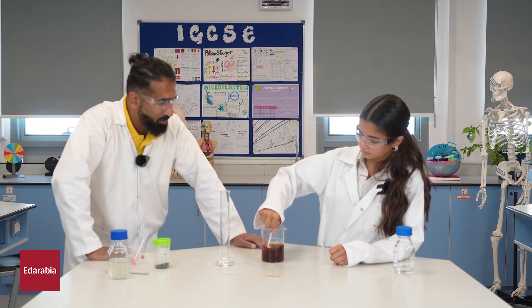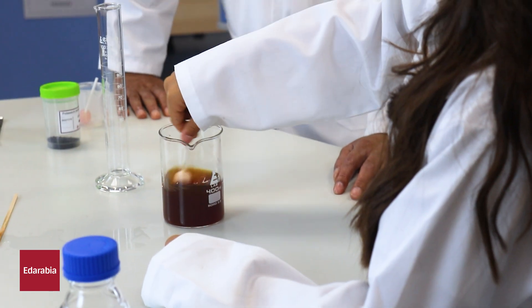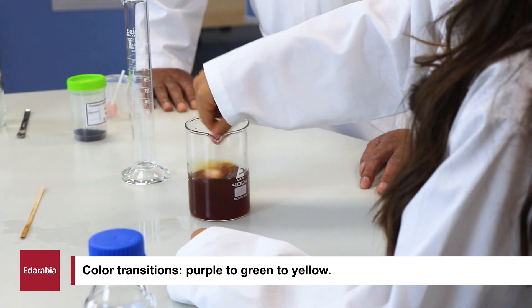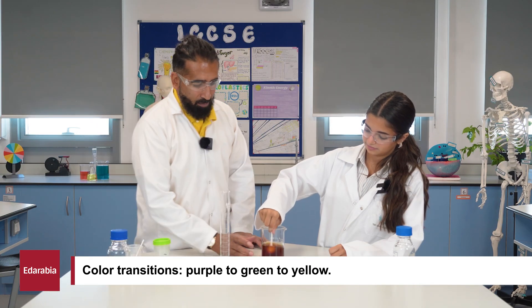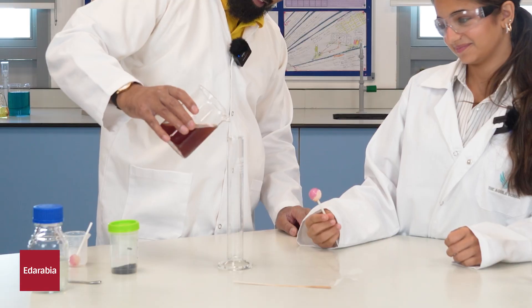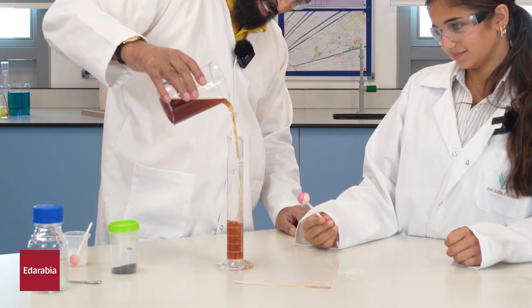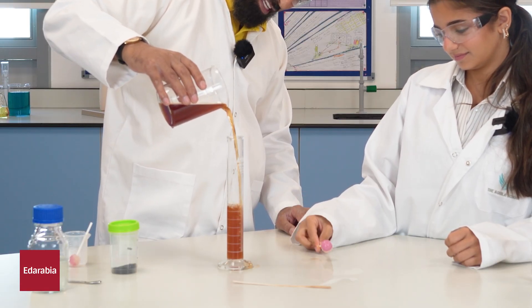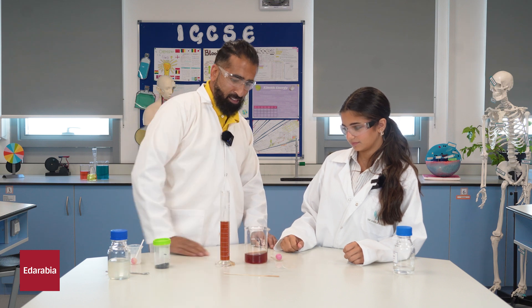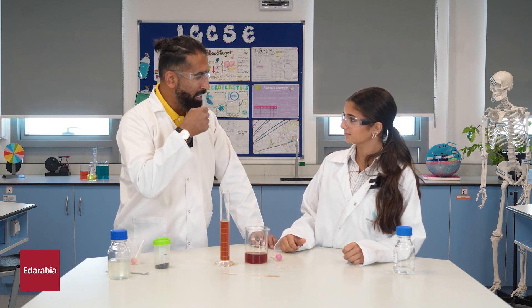So what colours did we start with, Maria? Purple. Started with purple and then eventually it went green. And now — has that blown your mind or what? Yeah! So cool. Oxidation states — tada!